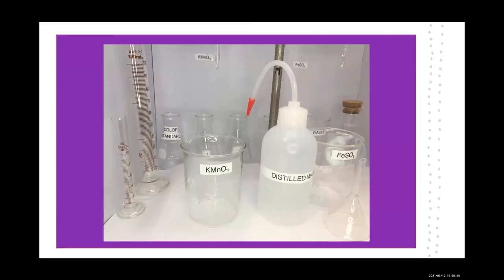So for this lab, I am trying to work inside this little white box so that you can really see the color change. There were some complications with this. It was very difficult for me to get a good angle for titration. When I titrate, I like to use my right hand to control the stopcock and my left hand for swirling the flask, but I could only get one arm in and not obscure the camera too much. So I actually overshot my titrations more than I would have liked. But hopefully when we do it in class, we'll have better luck because we won't be working within a tiny little box trying to get a good view of the color change.